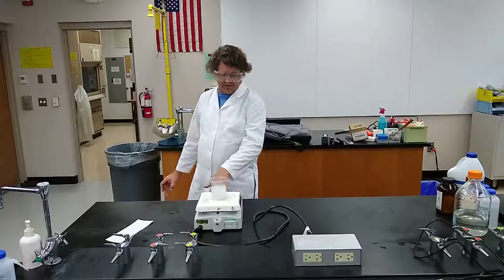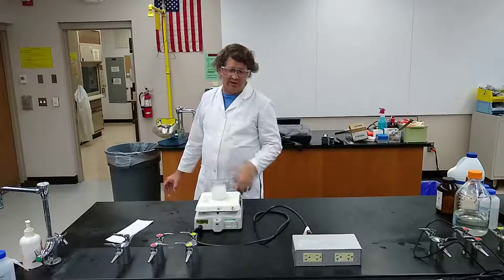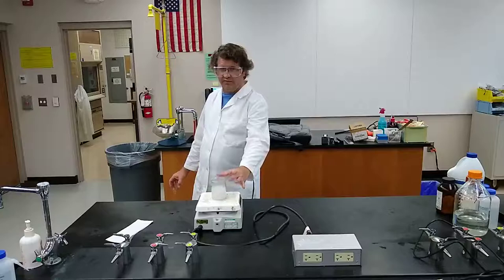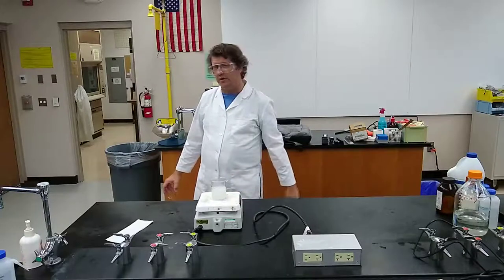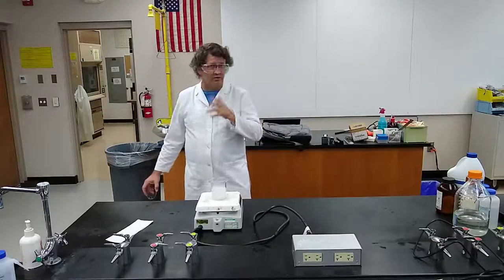I have the heat totally off, but the stirrer is still going. Before I do anything with this, I want it to cool back to room temperature. Once it's stopped boiling and cooled enough that I can touch it, I'll probably put it in an ice bath to speed up the process.